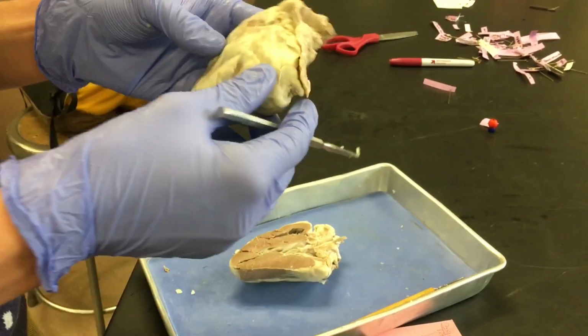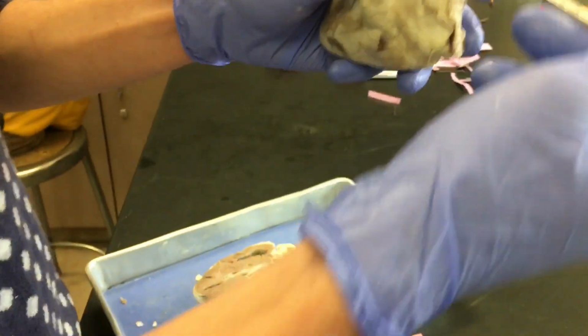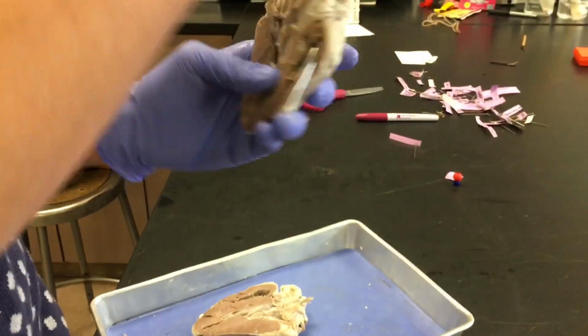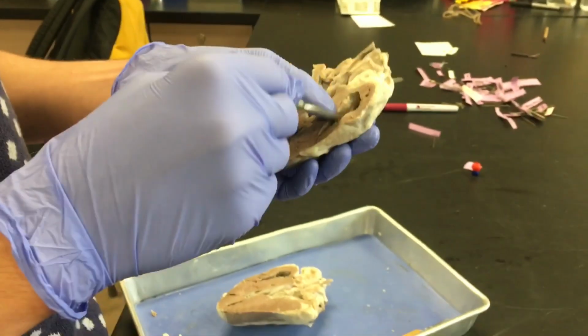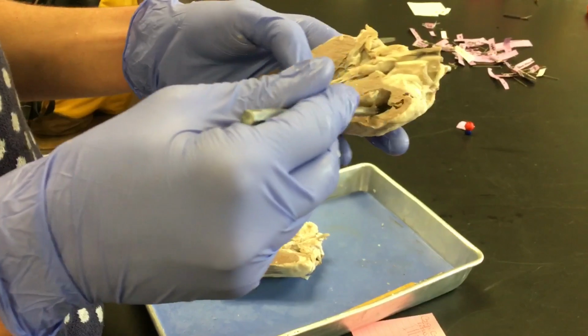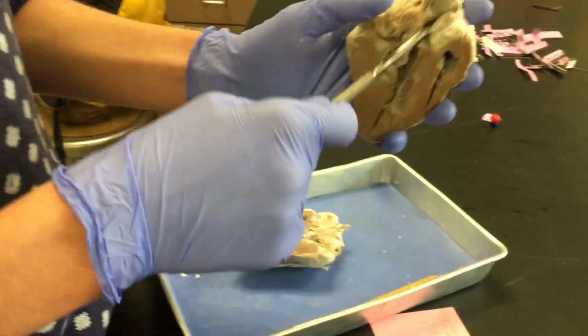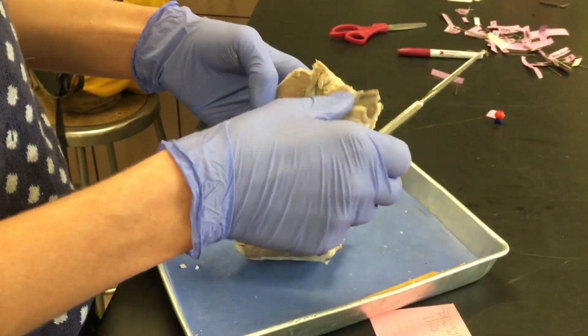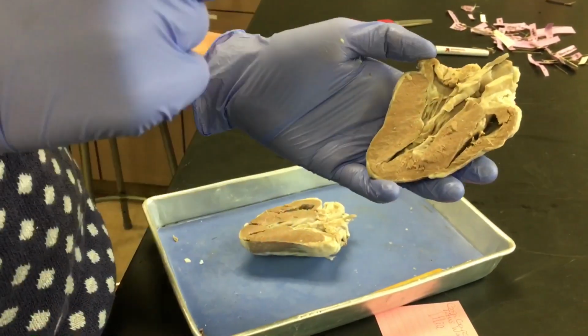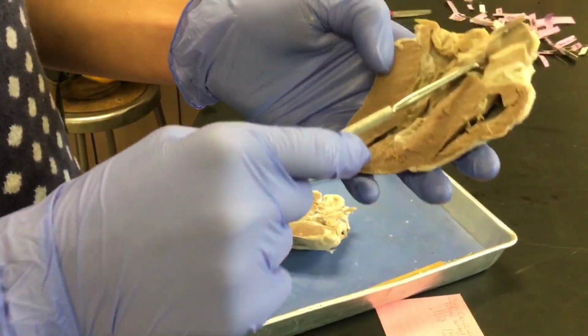When it comes to the great vessels, this is the anterior side, as we can tell by the pulmonary artery or trunk right here, and it passes through the right side of the heart, the right ventricle. It's separated by a pulmonary semilunar valve. Again, it can't really be seen, but it's there. Here we have the aorta, and it's separated from the left ventricle by a semilunar aortic valve.